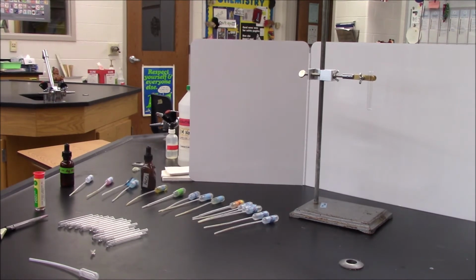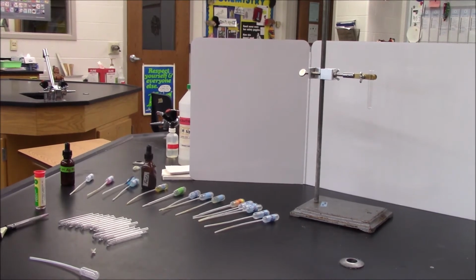We're going to carry out each of these reactions in a small test tube. The substances are in the labeled droppers, which you can see on the table in front of us. I'm organized. I laid them all out and alphabetized them so that I can easily find them. When I go through each reaction, I'm going to identify the substances and add 2 to 3 drops of each. I'm going to be careful not to touch anything to anything else, because I don't want any reactions or contaminations to occur that I didn't intend.